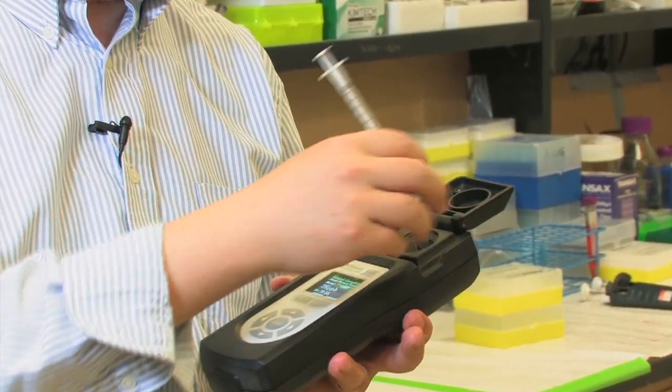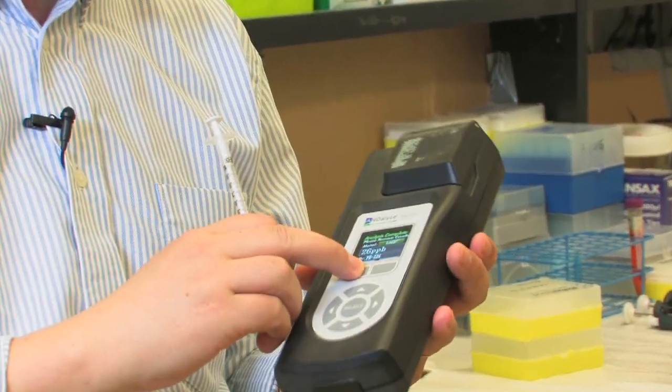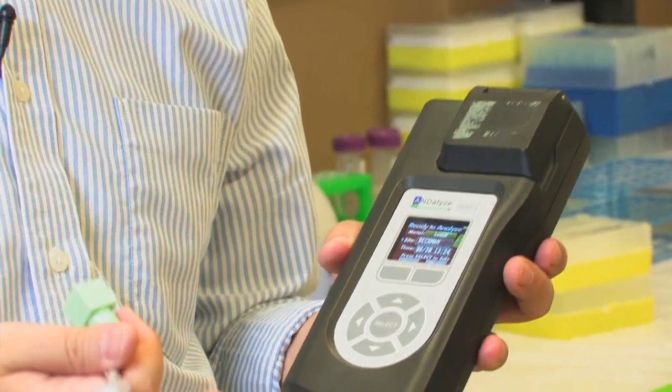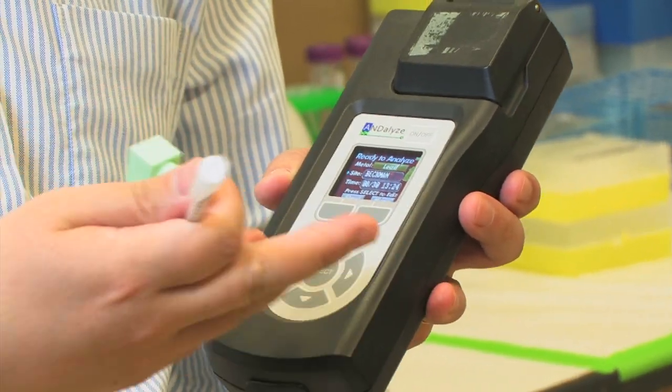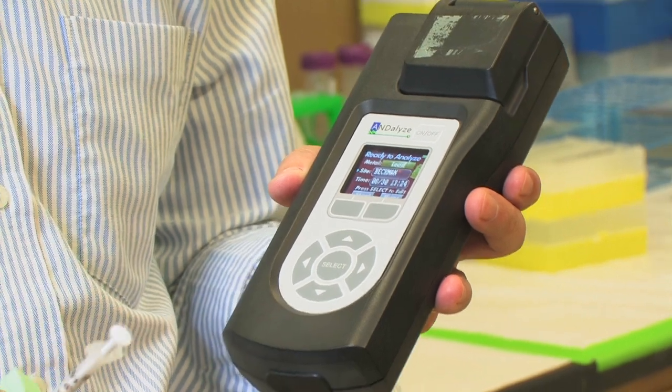Then take it off and close it and push start. And then in about two minutes, one can get a reading of the sample concentration. In this case, lead.